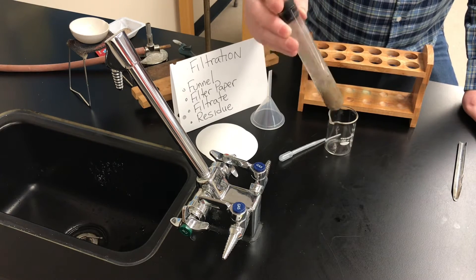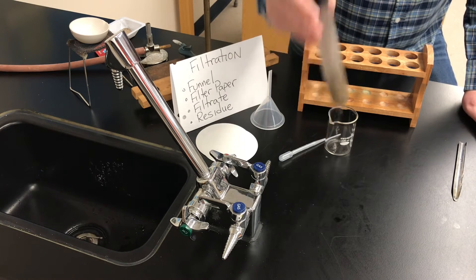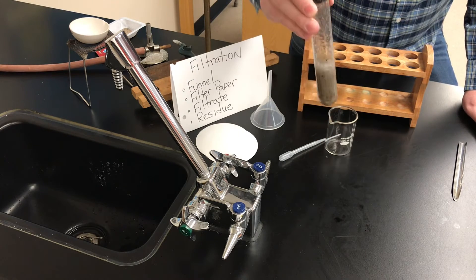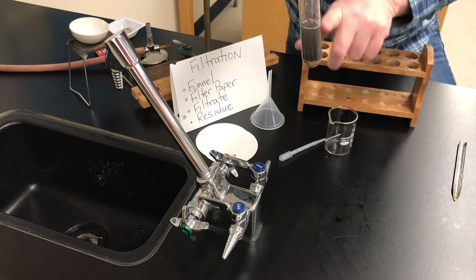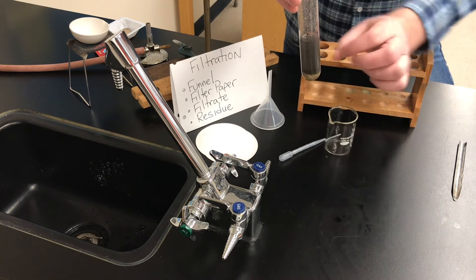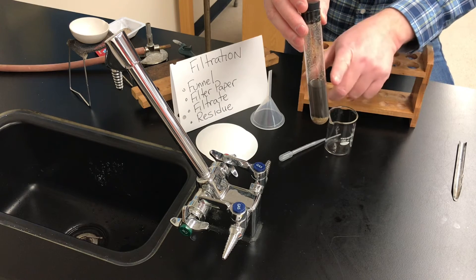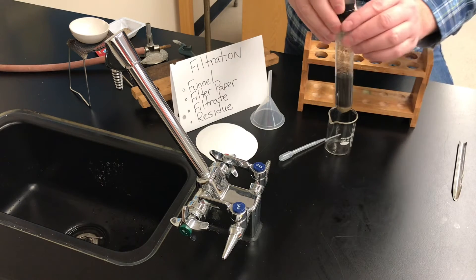By adding the water and shaking it, I'm pretty sure that any salt in there will end up dissolved in the water. When I stop shaking, the sand — which is very dense — immediately sinks to the bottom, and now the liquid has a lot of gray charcoal suspended in it. If I let this sit for a long time it would settle to the bottom, but maybe right now I can do something kind of clever.